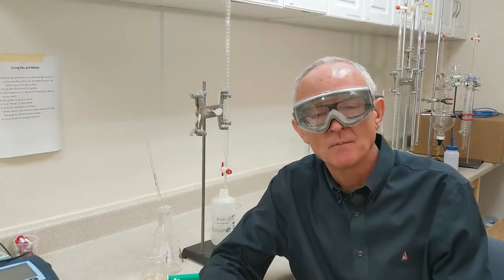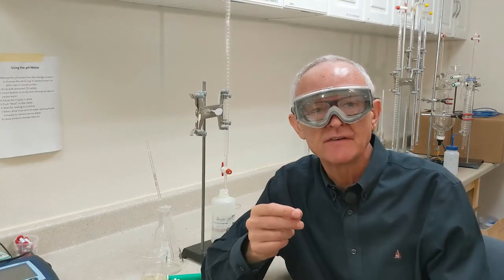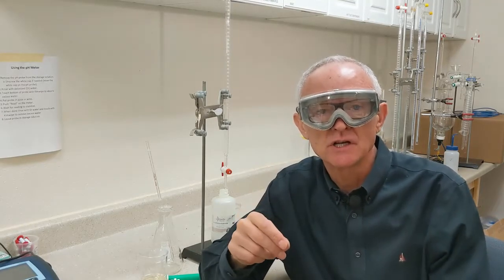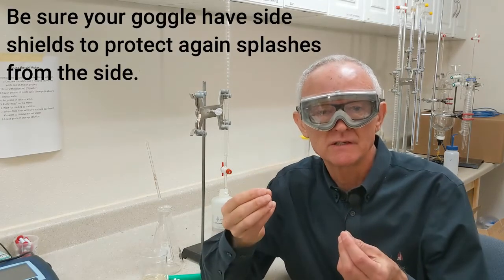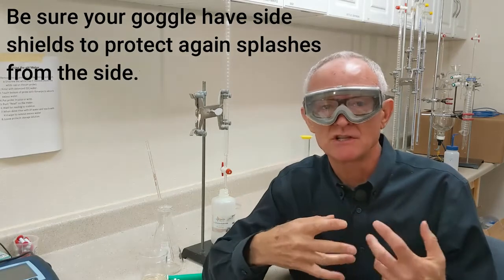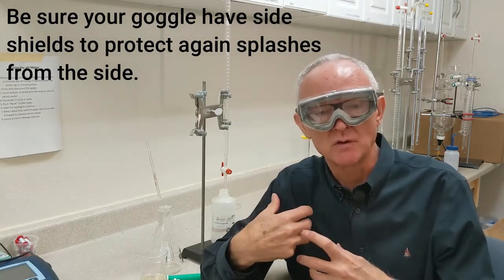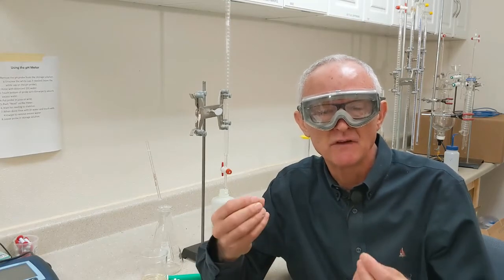We're using sodium hydroxide. That's a strong base. We use it in fairly low concentration but it's still strong enough to especially hurt your eyes. You don't want to get it on your skin. If you do, just rinse it right off.